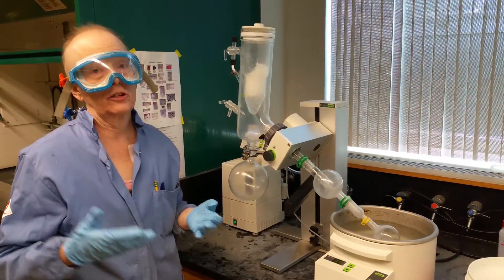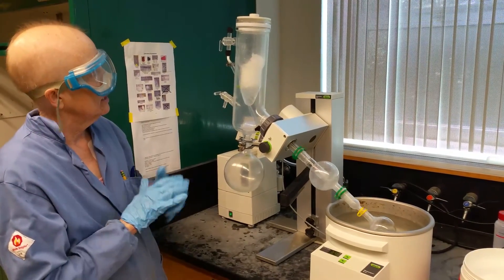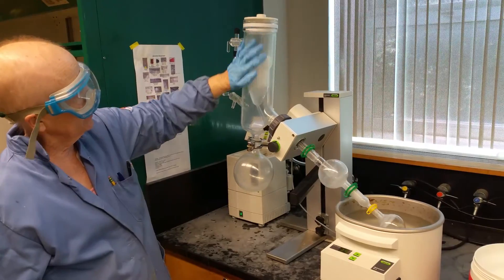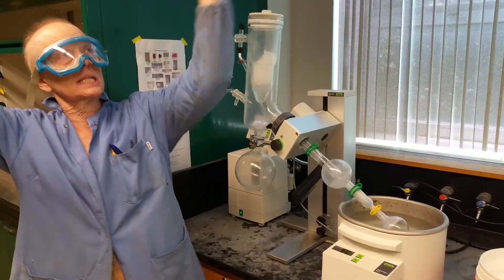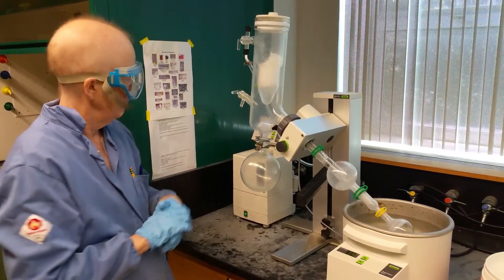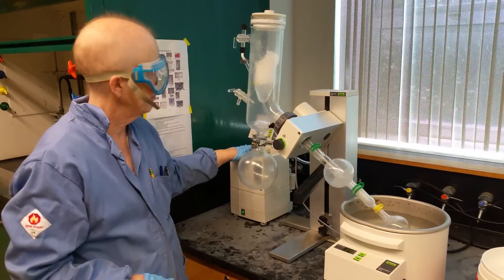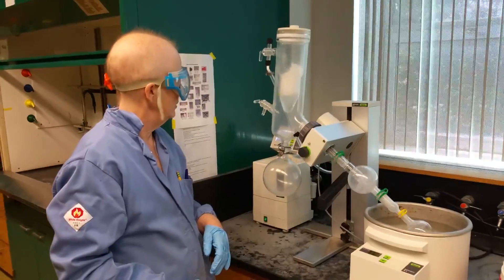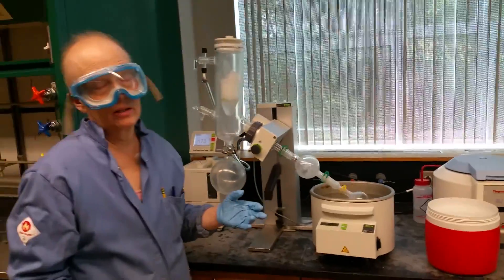And it's distilling at a pretty good rate, and I don't even have dry ice. Now you might wonder, why did we switch to this kind of apparatus? Because it's better for the environment. Particularly when we have dry ice in here, we collect all the liquid. There's no liquid escaping out into Bryn Mawr. Also, we have better control over the pressure and we get a much more rapid distillation.